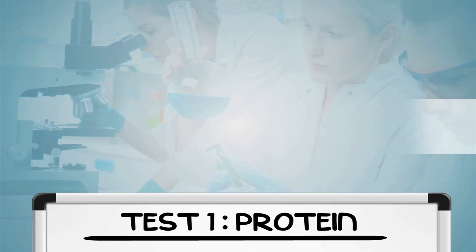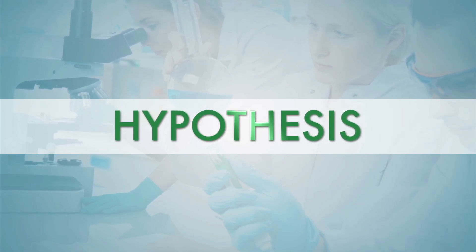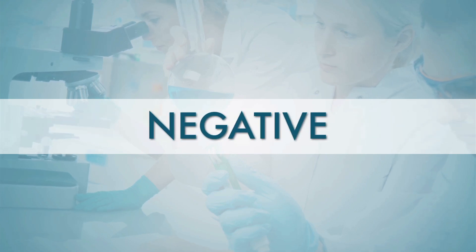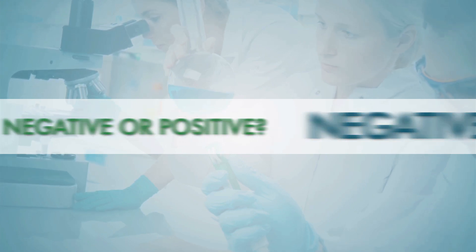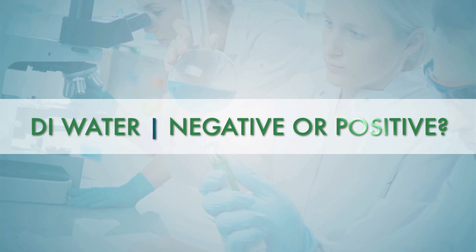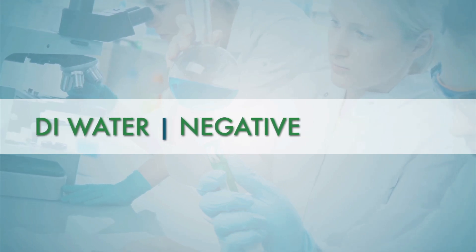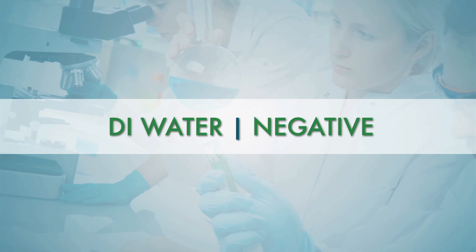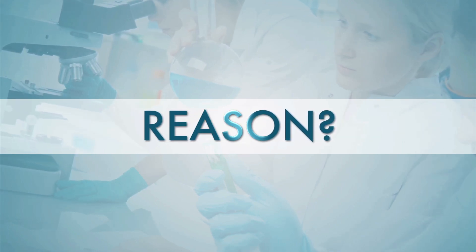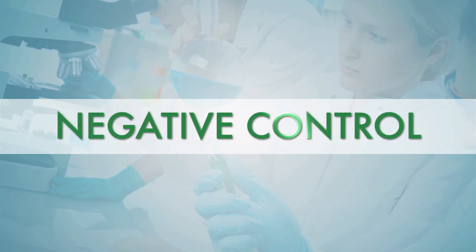Please take a moment to make an educated guess — called a hypothesis — as to which substances will test positive or negative for protein. For example, do you expect DI water to test positive for proteins? The answer is no. DI water will serve as our negative control, meaning we know it should not contain protein.